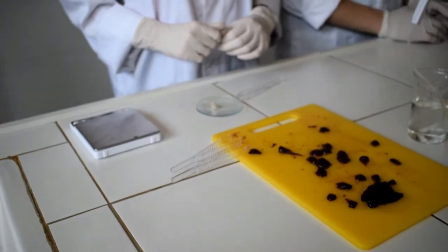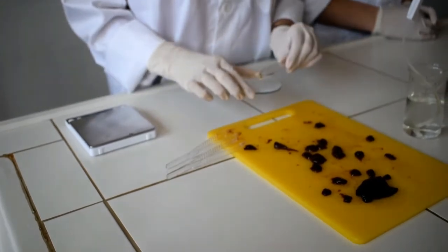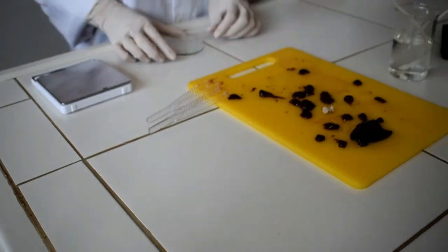The protein composition results in the whitening of the used liver. This is observed when the protein is exposed to extreme environmental conditions and is attributed to the denaturation of the protein.